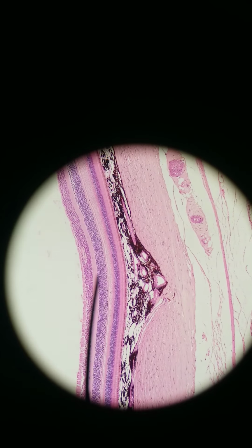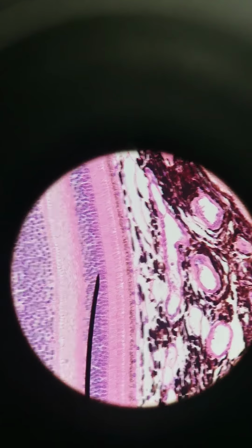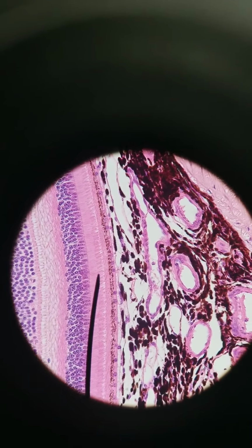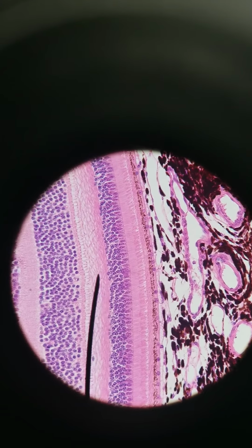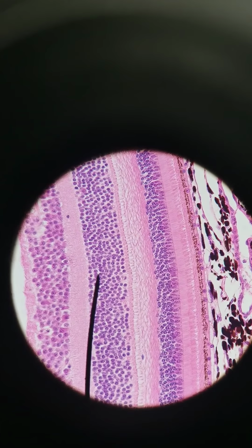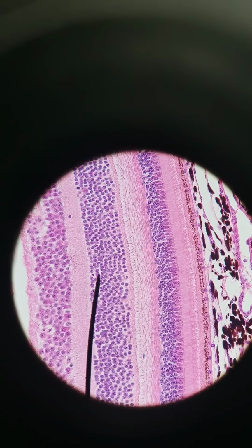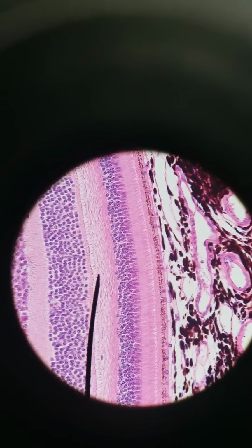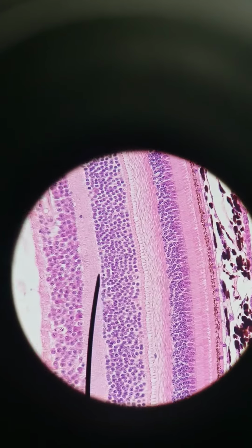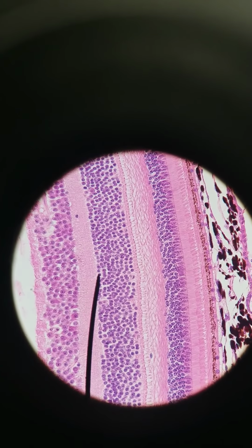Here we are at the back of the eye, the retina. I'm at 400x now. Where the arrow is, these are the photoreceptors and their nuclei. And then here, where I'm pointing, these are bipolar cells. So these are the nuclei of the bipolar cells. Their dendrites are right here. Their axons are right here. So they're very short. The whole cell fits in this image.